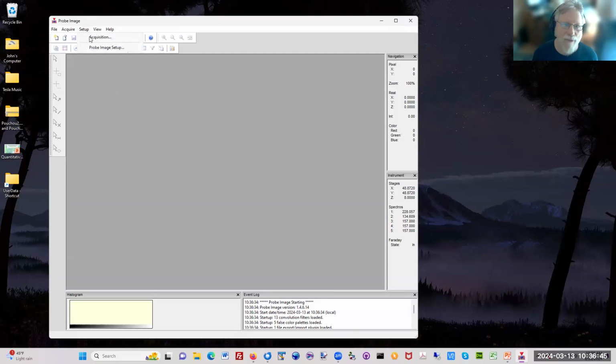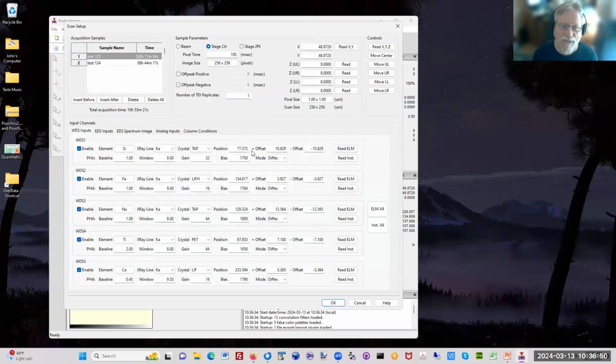So if you're acquiring maps with ProbeImage, you will go to the setup acquisition window here, and you will have a list of samples and setups. Of course, you can only do up to five elements at a time, depending on how many spectrometers you have. But then you can combine multiple spectrometer passes to create any number of maps per sample. And you can also do replicate maps, which is what Annette will probably talk about later in terms of the TDI applied to maps. Instead of doing a TDI curve for every point, we do a TDI curve for every pixel. And it turns out that we do that by replicate frame maps.